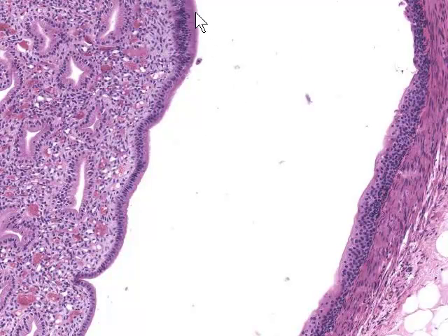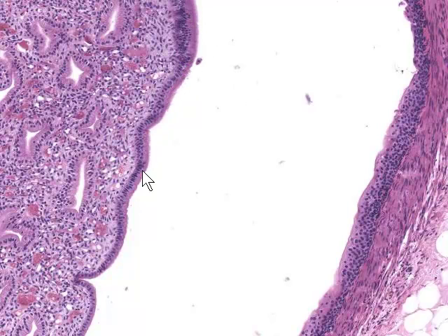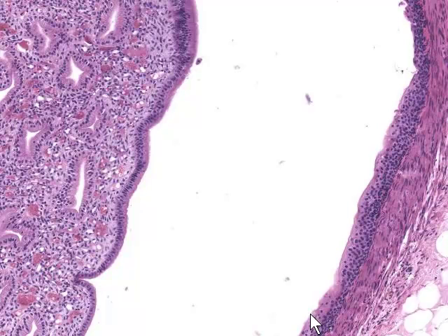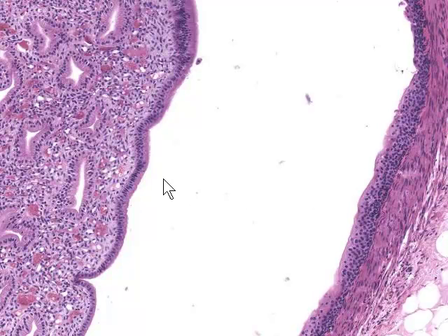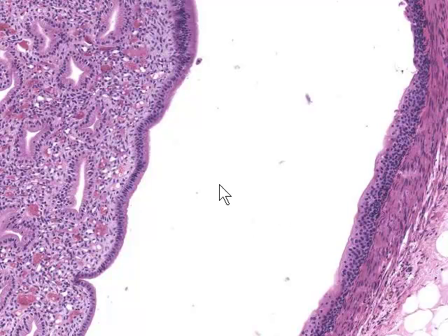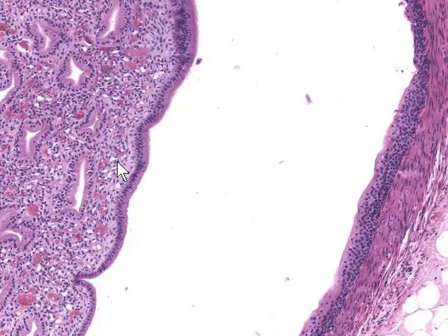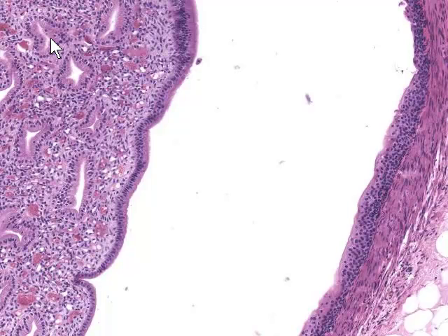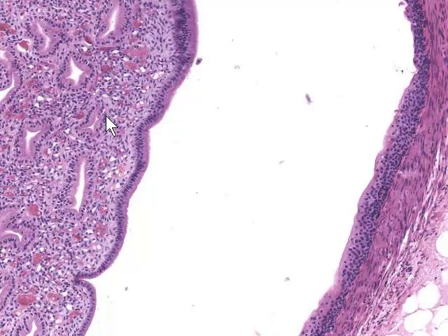We're going to look at the tip of this medullary pyramid, the papilla, and examine the epithelium lining the papilla, some of the ducts present in the papilla, and then move across onto the calyx to look at the epithelium of the calyx. Here again for orientation: here's the papilla, the tip of the medullary pyramid, and here's part of the minor calyx. The space here is the space across which urine drips from the tip of the medullary pyramid. We can see these large epithelial-lined tubes — these are the terminal parts of the collecting ducts — and some other tubular structures as well.